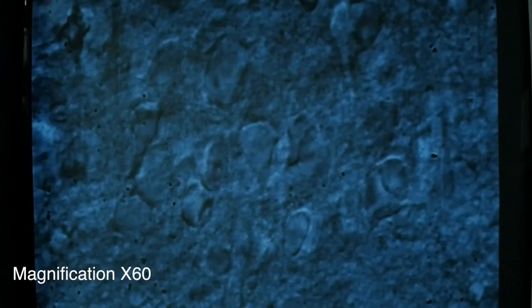In this case, we use high contrast infrared video microscopy. It is important to find a region with healthy cells. In order to do that, we look at the slice while focusing up and down until we find a good cell to record. Now, we prepare our patch clamp recording electrodes.